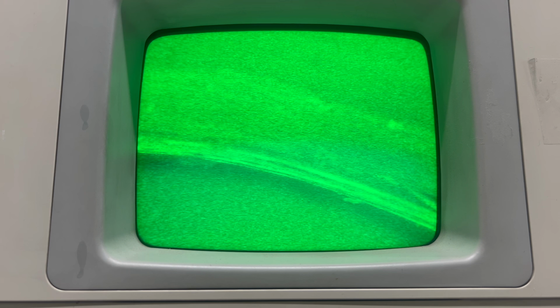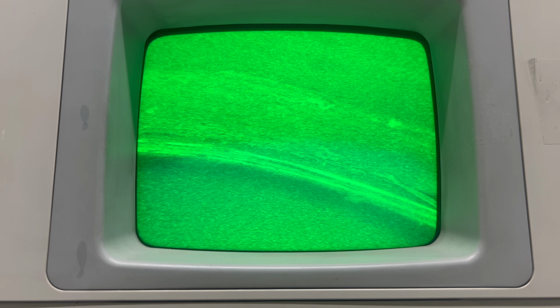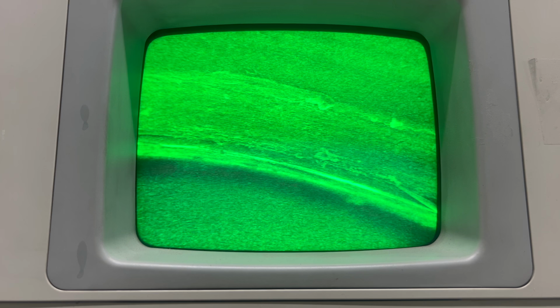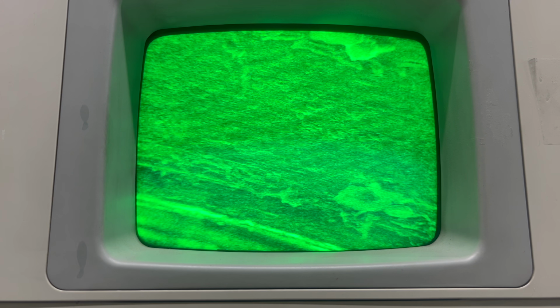Let's see if we can focus the microscope. Hey, that's more like it. It looks like the image is coming into focus. This is fantastic. I'll be honest, when I first got this machine, I did not expect to get this far. It looks like our repairs have actually succeeded. This machine is actually working and producing images of reasonable quality.